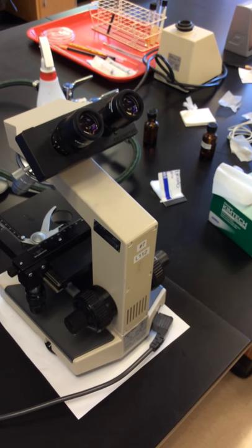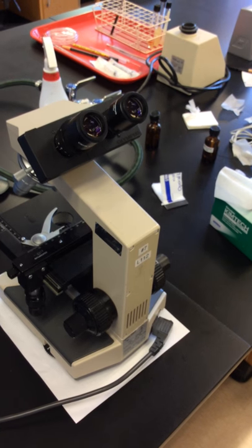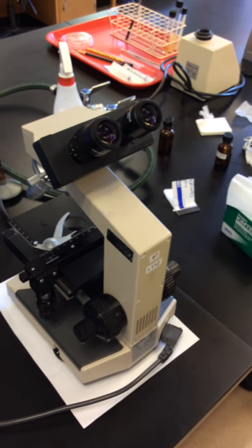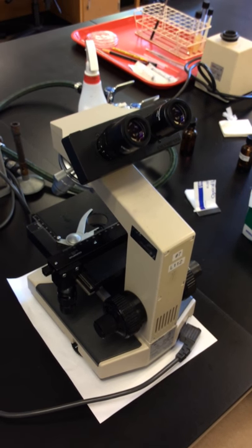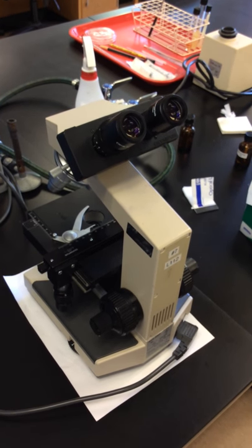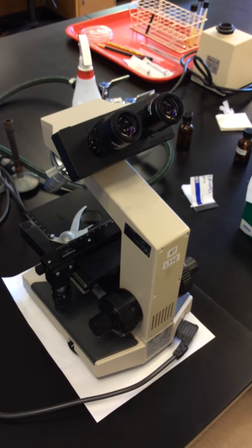When you replace the microscope on the shelf, make sure you don't drag it or push it across the shelf because the little rubber pads will catch and the microscope will bounce, and that can ruin the lens and the mirror system.